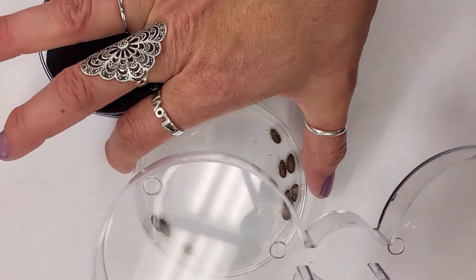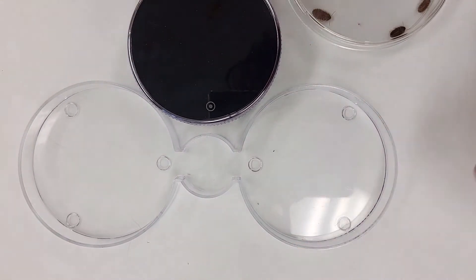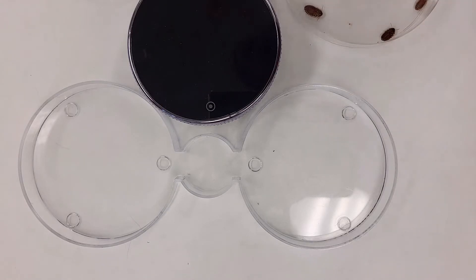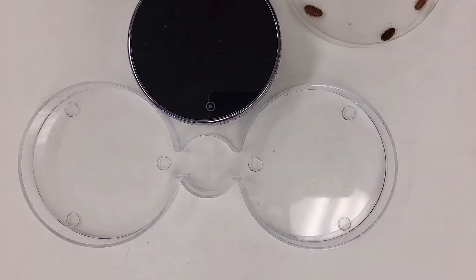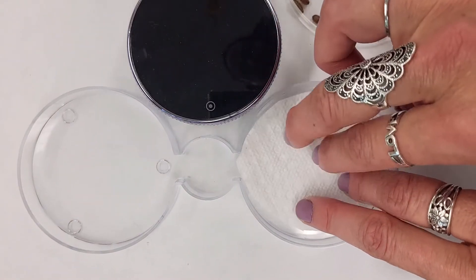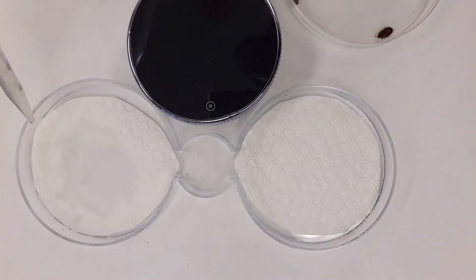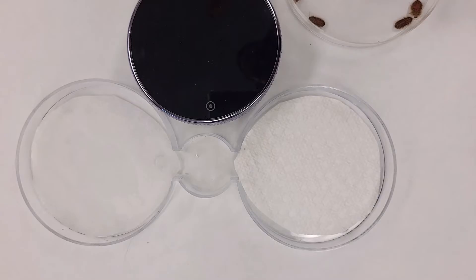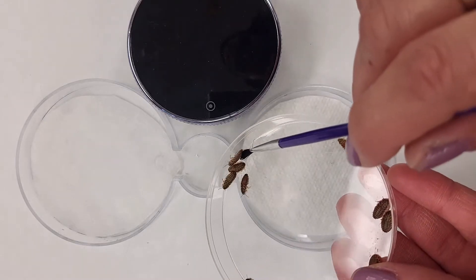So what we're going to do now is we're going to use a choice chamber. First we need to cut a paper towel and put that in. I've taken a paper towel and cut some circles, so I'm going to put one on each side, and I'm going to wet one of them. So if you've got a spray bottle with some water — we're going to have a wet side and we're going to have a dry side.